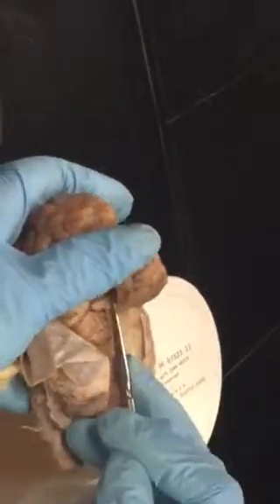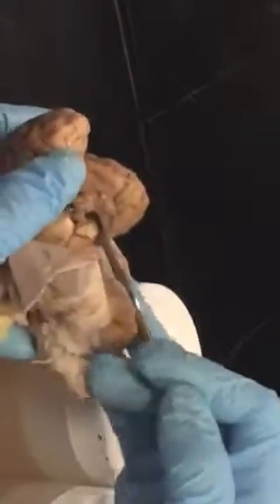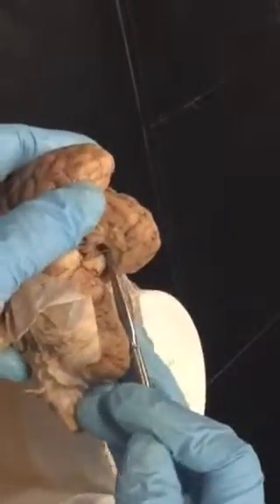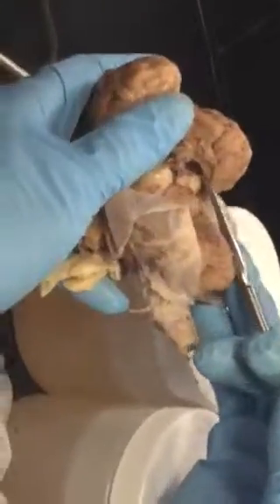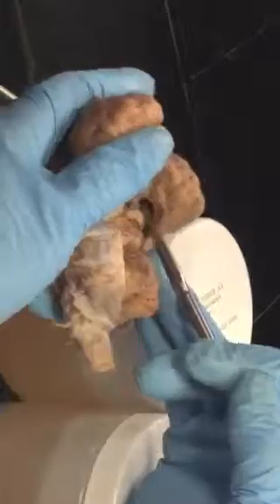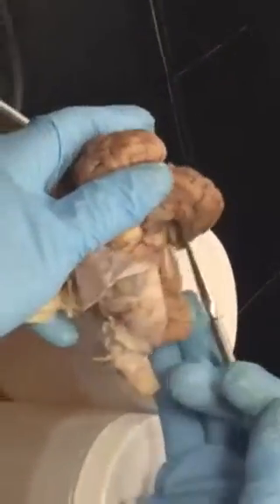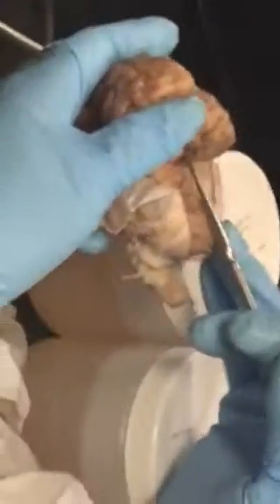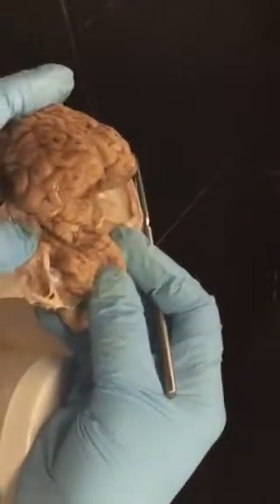But the space surrounding it, do you see the space? That's the ventricle, filled with cerebrospinal fluid. And some of you asked me, Emily, you asked me about the choroid plexus. You can find them in this region. Does it make sense? In life, they are not really reddish. Yeah, a little bit reddish because of blood vessels. So this is what you can see in the dorsal view. Does it make sense?